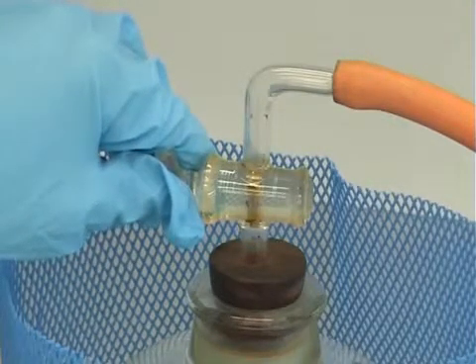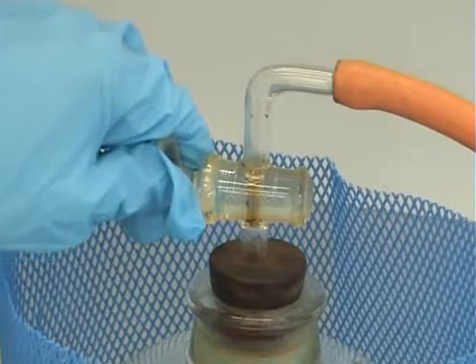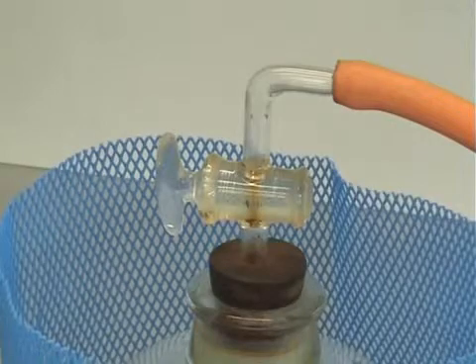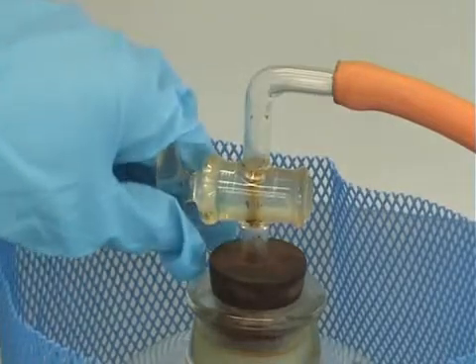Once the hissing stops, you can open the tap all the way. You can then leave the desiccator like this to dry, or you can close the tap.